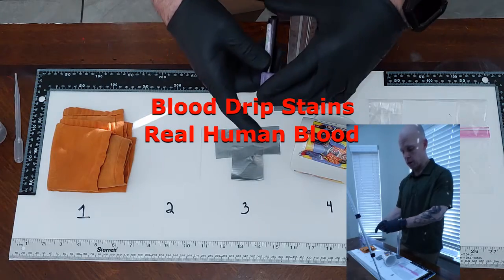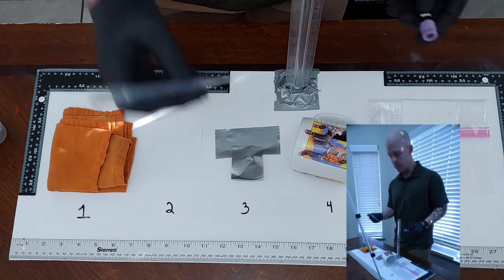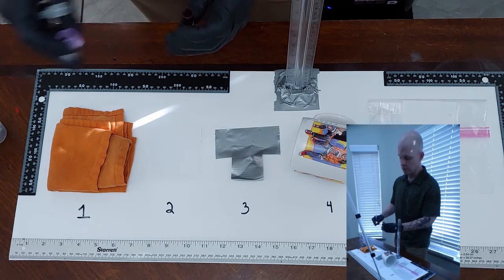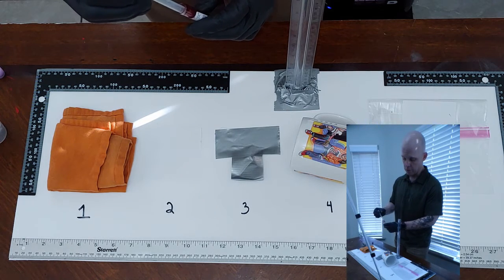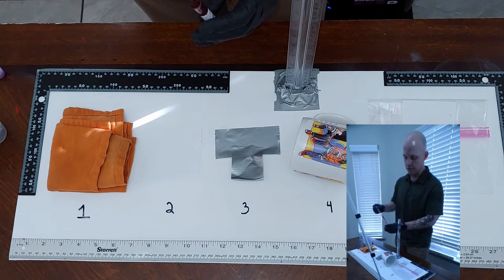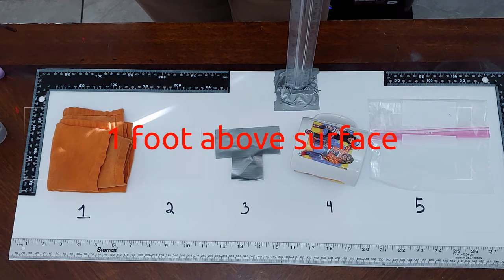This blood's been sitting for a little while, so I'm just going to kind of shake it up before we use it. I'm going to be using a pipette just to create the drip stains, and it's going to simulate blood accumulating on a surface and then falling under the force of gravity only. So there's no impact involved in this. It's just blood falling to the surface under the force of gravity only. Okay, so we're going to do it about 1 foot off the ground for everyone.